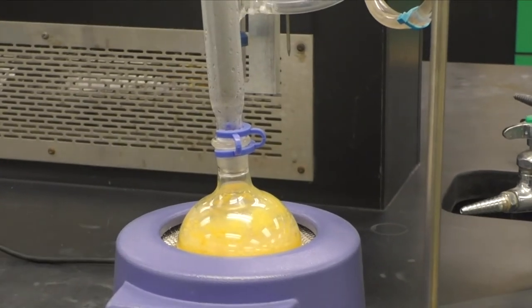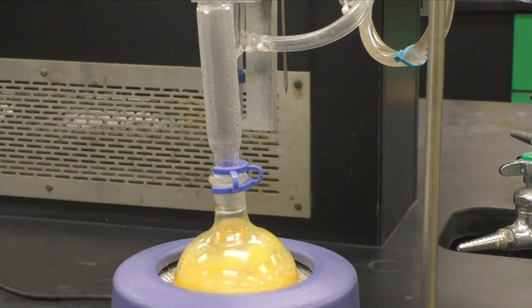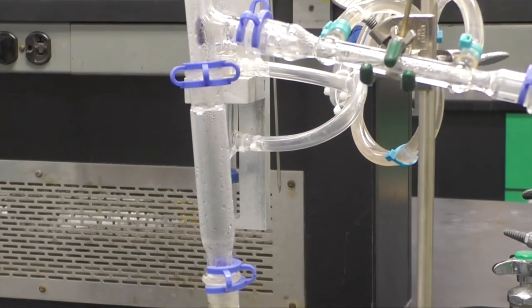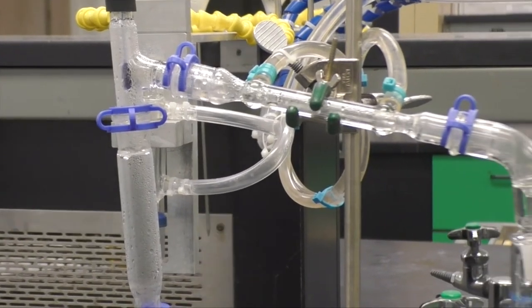Using a high heat setting, heat your mixture. The contents of your flask will begin to boil and you will eventually see vapors go up and over into the arm of the three-way adapter.